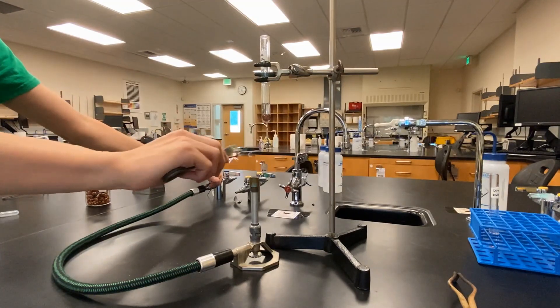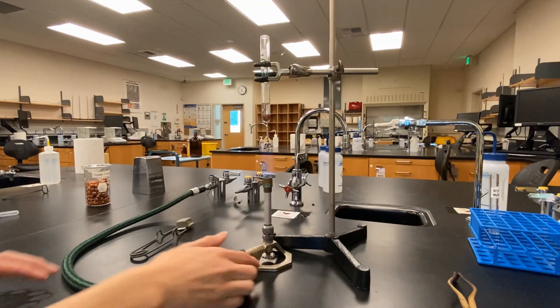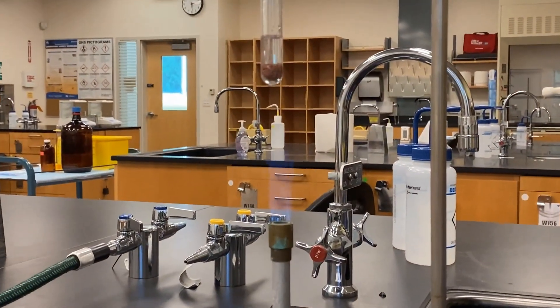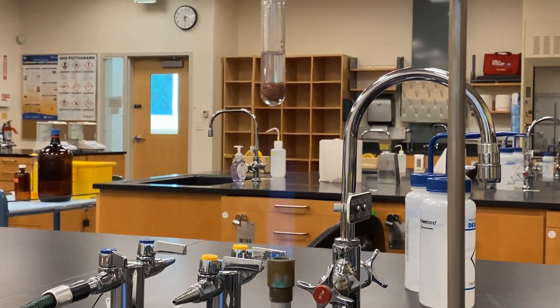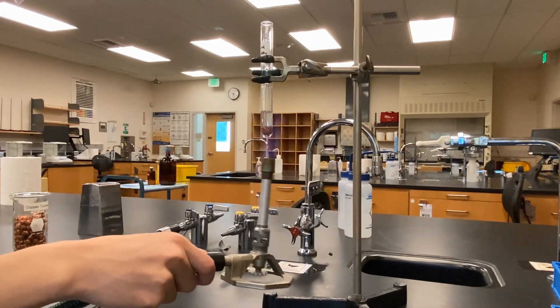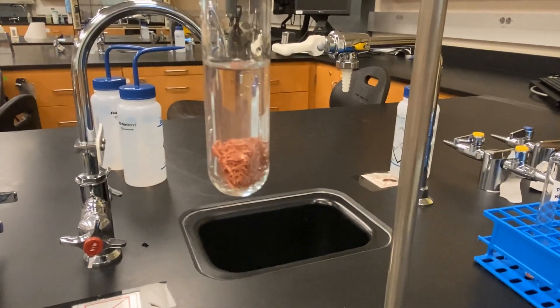Use a striker to light the Bunsen burner and then move the Bunsen burner around to gently heat the sulfuric acid and ball of copper. Like with the sulfuric acid in our first test tube, we want to avoid boiling the solution, so we are heating it gently. Let's get a closer look at what is happening inside the test tube. This concludes Part C and our experiment with copper.